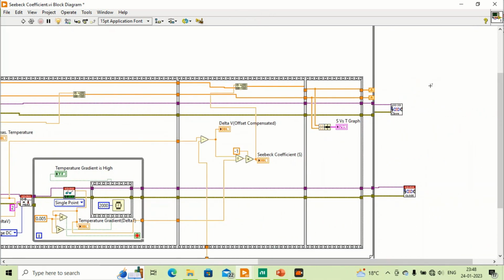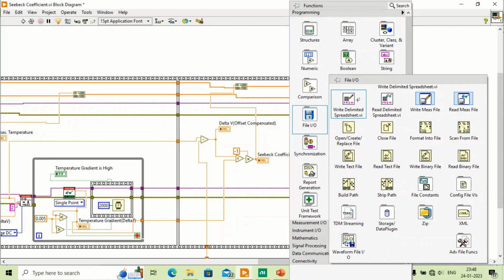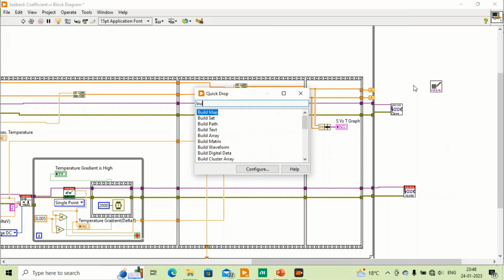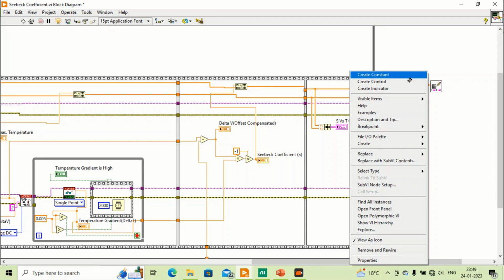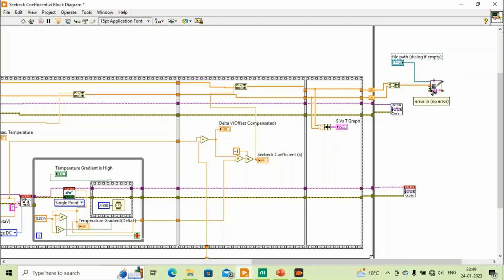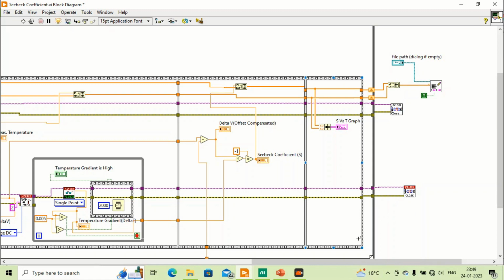Now I also want to save data, so I just write file IO, write delimited spreadsheet, and also build array to the data, so 2D data, and make it a control to put the file path, and I have to make it transpose. Okay, so it's complete now.